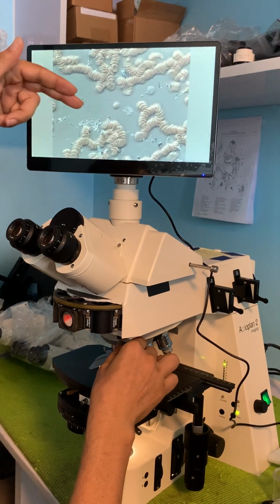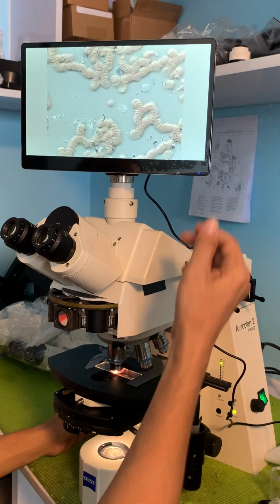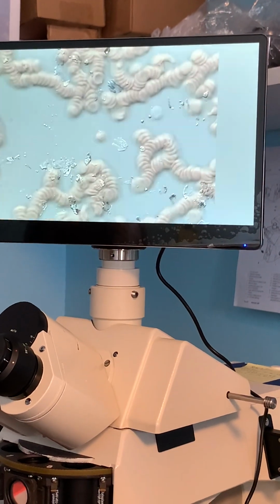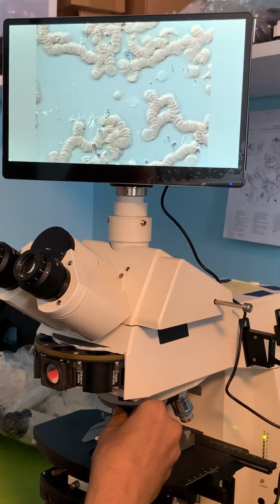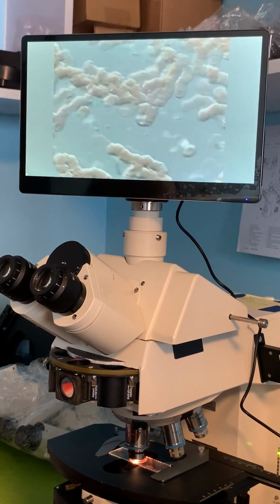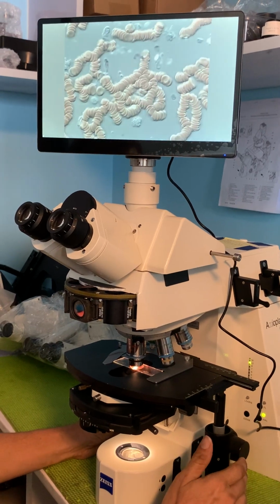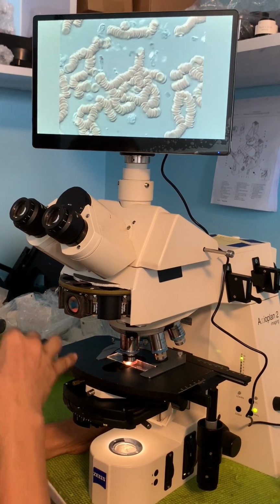And we can see some of our background here. We can see some of the DIC coming out at us like a three-dimensional effect. Let's try to get some of this into focus in the background. All of these are starting to show a relief, like a relief contrast. Let me move the slide around a little more. And by the way, this is oil immersion. We do have a drop of oil on the slide.